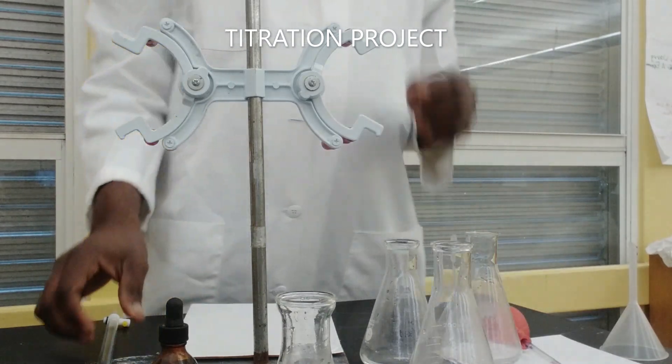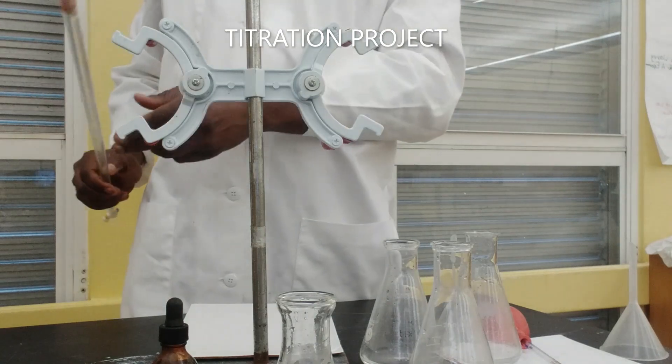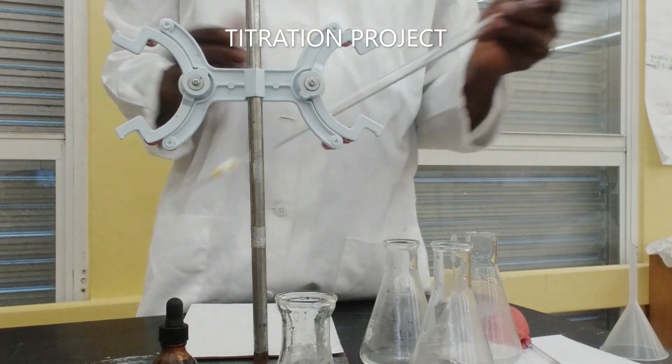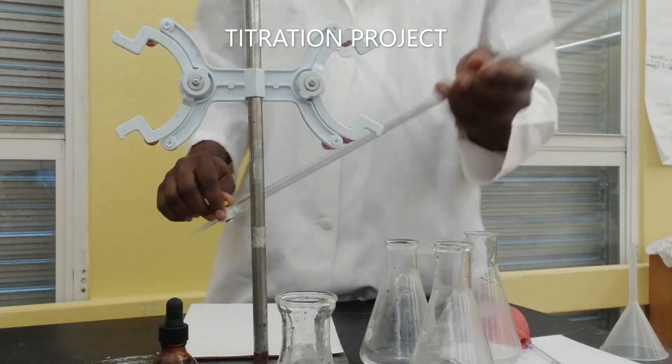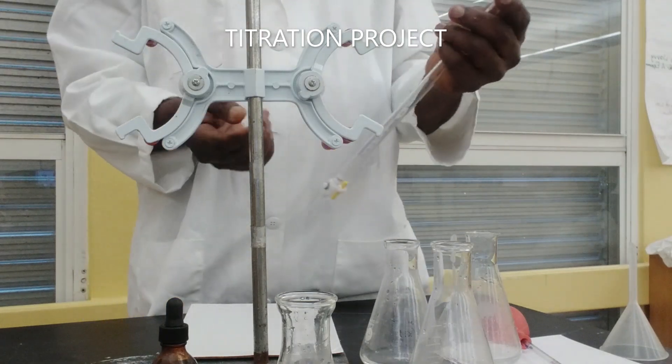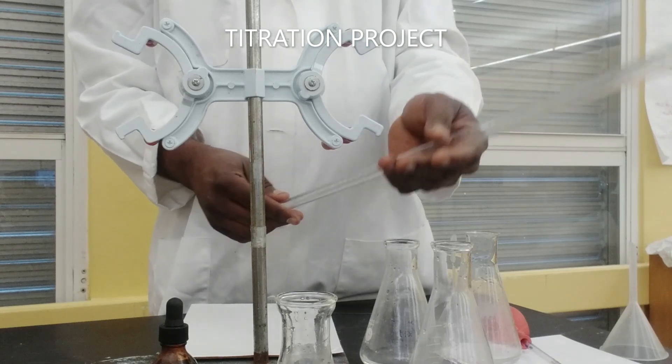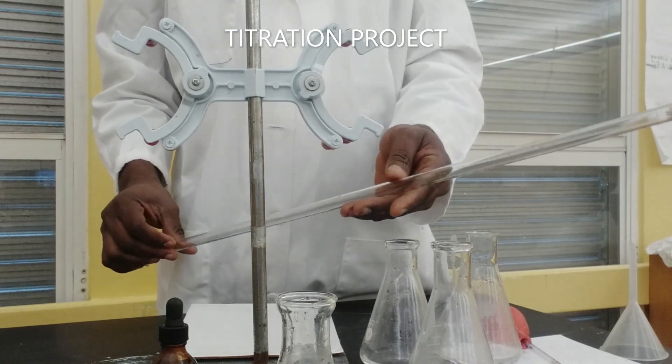Next we're going to transfer the base. I've decided to titrate my base against the acid. So in my hand I have a burette, it's a 50 ml burette.